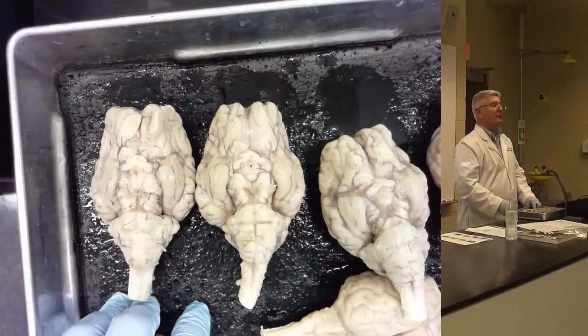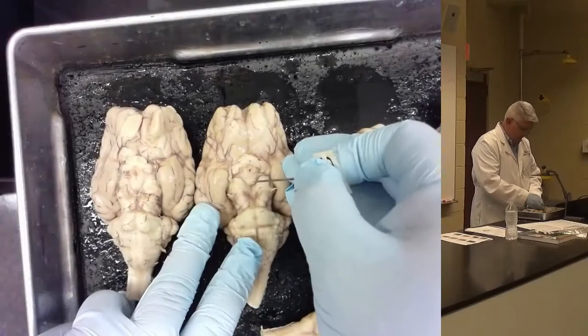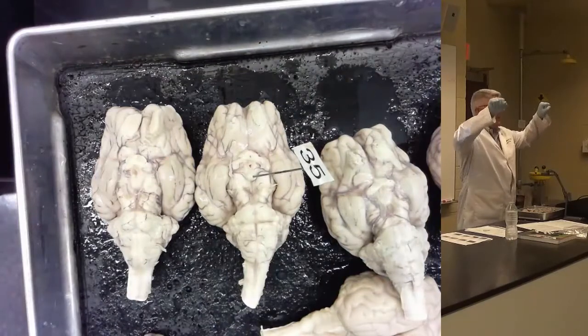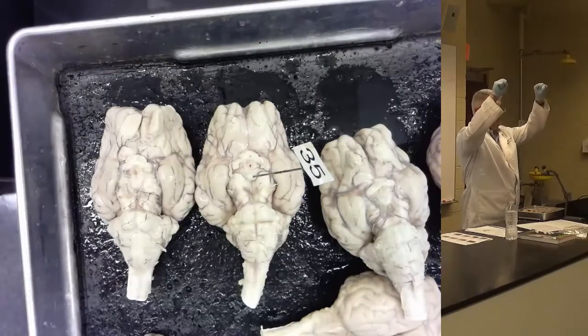Yes? And for the mammillary bodies, you can label either one? Yeah. I mean, it's really hard to see. I'll usually put it in like that. It's kind of a singular structure almost in the sheep brain. In the human, they're separated apart from each other, and you can actually see two little fists poking out of the brain.